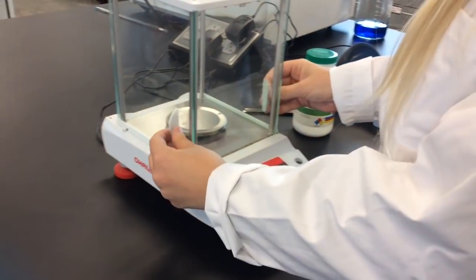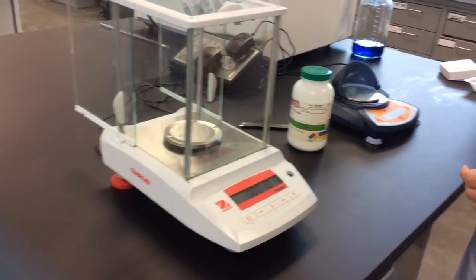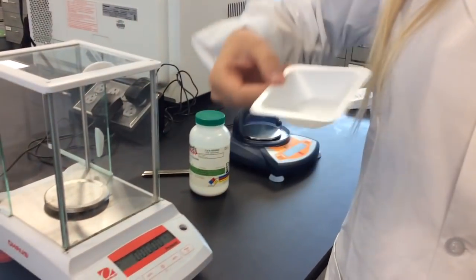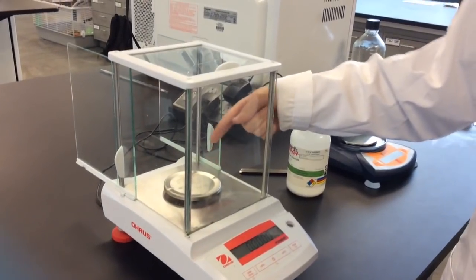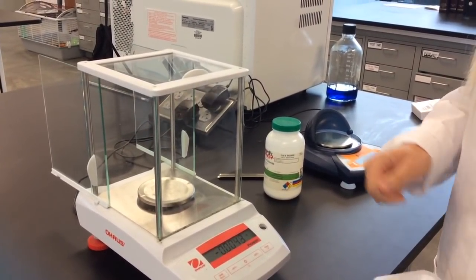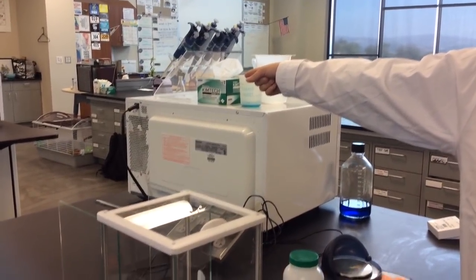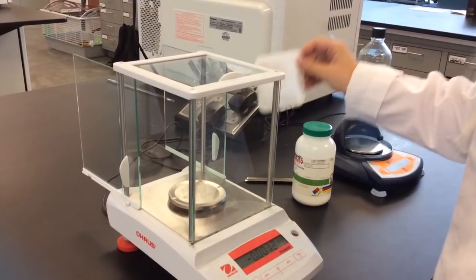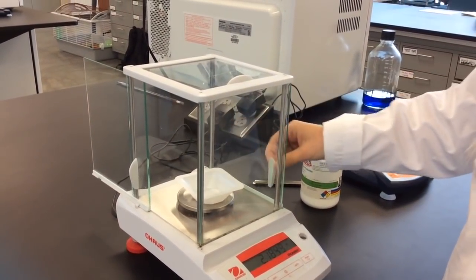In order to use this balance, we are going to open it up. For this example, I'm going to be using a weigh boat. You will not just stick solids directly on the balance — that's a no. You might make a mess; that's okay, just please clean it up. We have chem wipes and brushes that will help. So what we are going to do is place this weigh boat and close the doors.